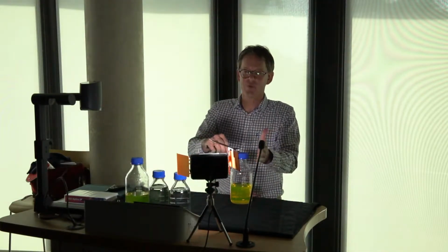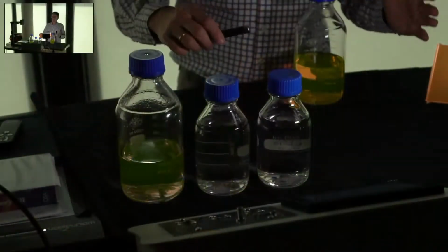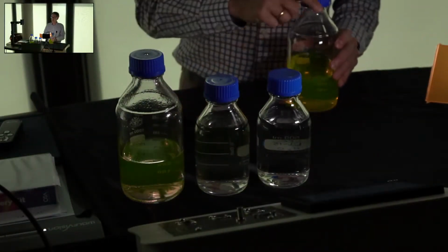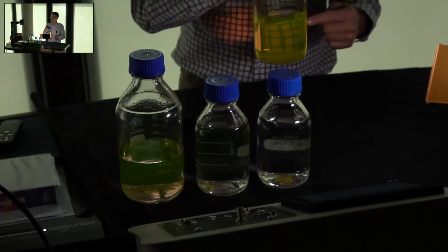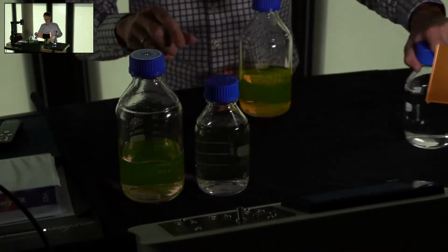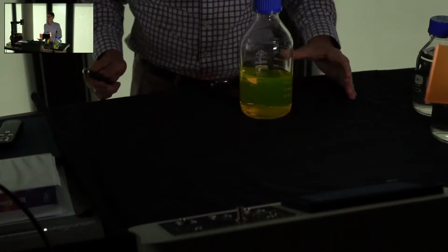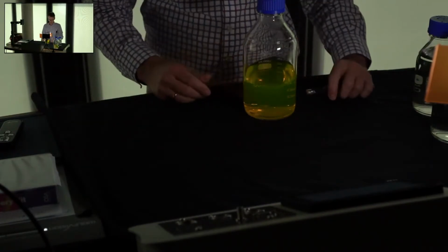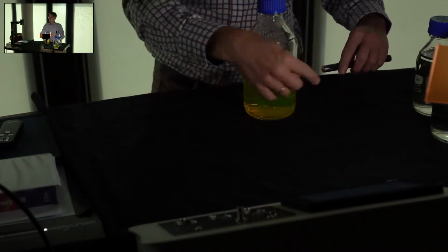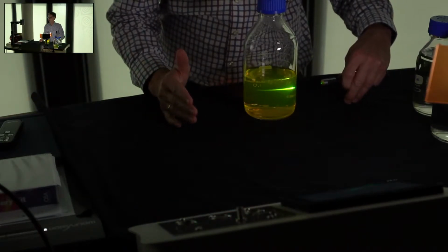And what I wanted to show you is that I have a green laser beam here. I don't know whether you can see this on my hand, so perhaps we can go on to the close-up shot. And what I'm going to do is pass that laser beam through the bottle here, and then you observe what you see. So let me just put these out of the way. These are the samples here, so you can see what's going on. So here's my dye solution, and I'm going to pass the laser beam now from this side through the bottle, and you can watch what happens.